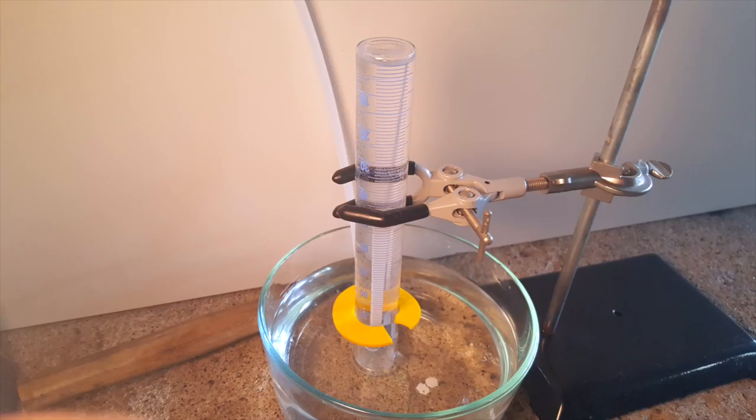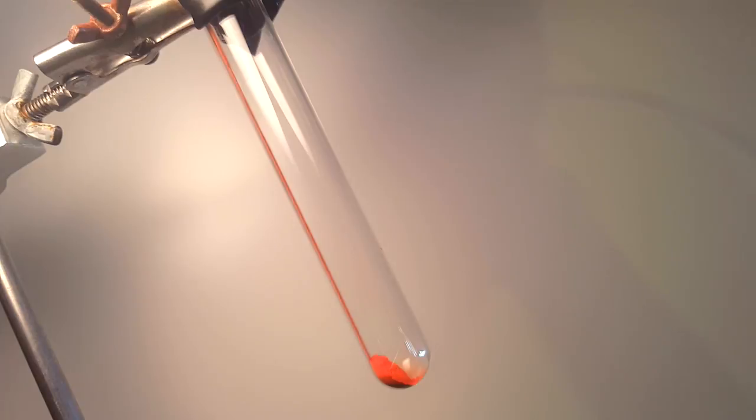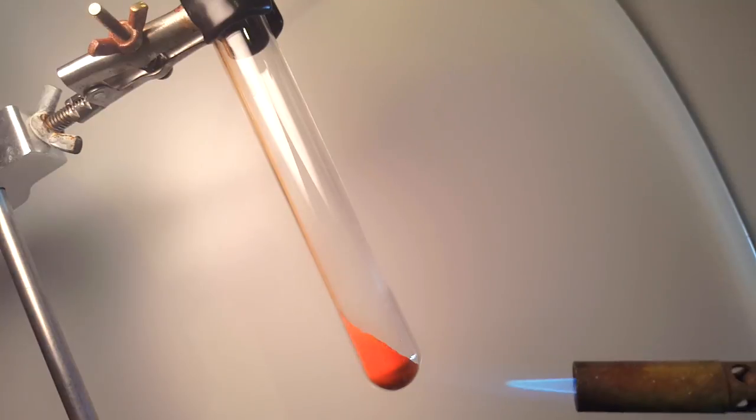The graduated cylinder is almost entirely filled with water, meaning the air that is collected inside will be nearly pure oxygen gas, with a very small amount of mercury vapor. When everything is set up and ready, I pour in the mercuric oxide. Then I start to heat things up.